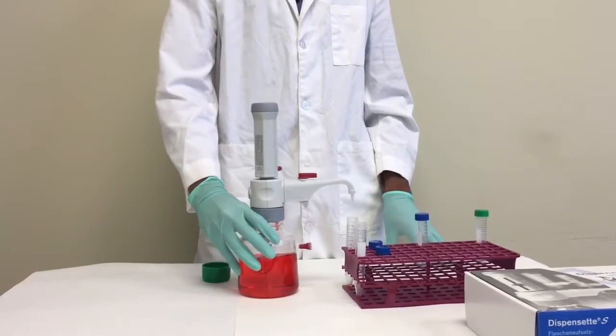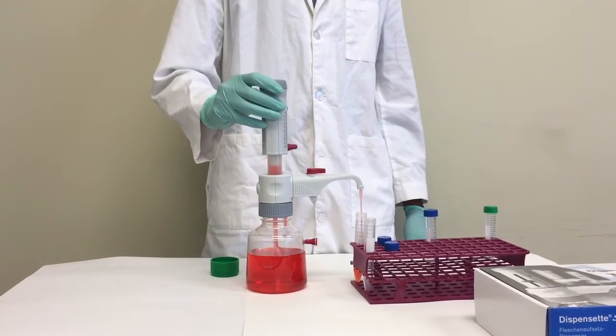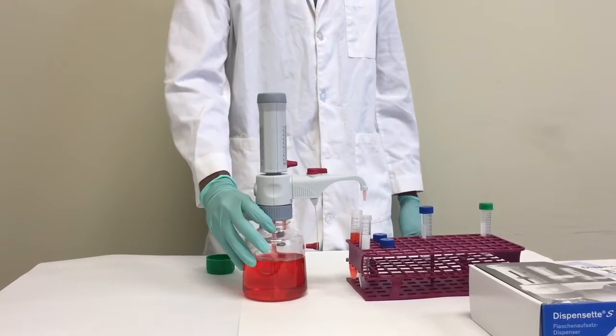To begin dispensing, pull up on the neck and then push down on the neck. This process should be very easy and you should feel little resistance.